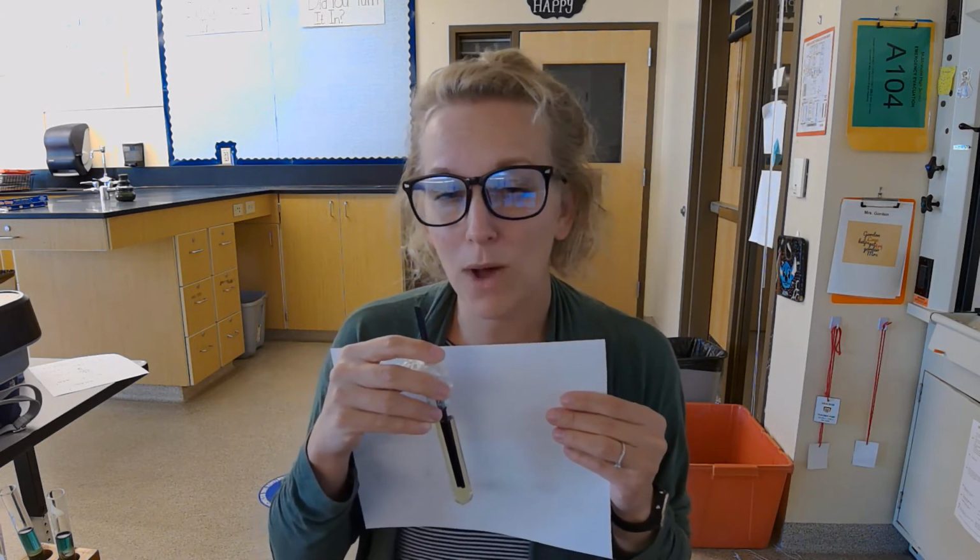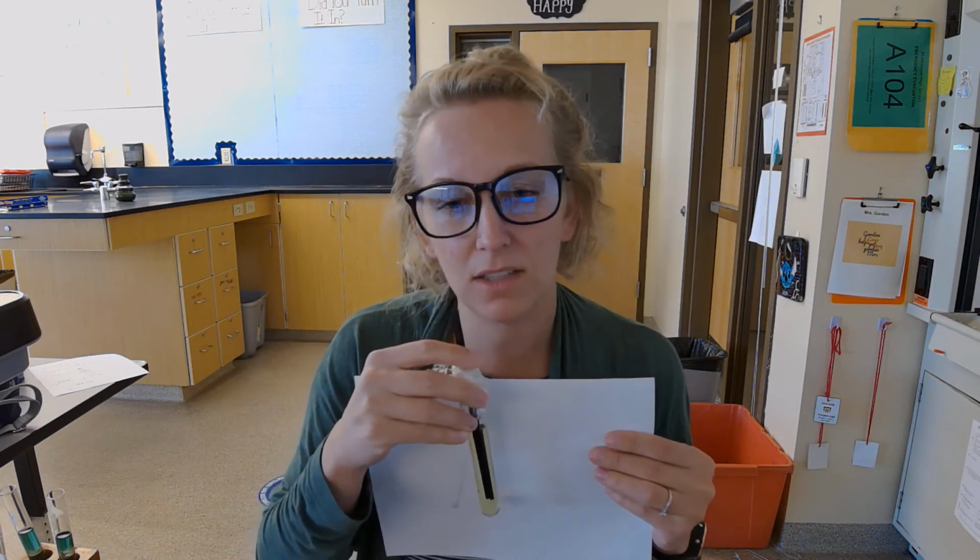All right, now, don't stop your timer just because I stopped blowing. What you want to do is stop the timer when you notice the solution having changed from that blue to that yellow. It was probably instantaneous. So what you may need to do is pause this video, rewind, and retime to make sure that you are stopping your timer when you see the solution change color.